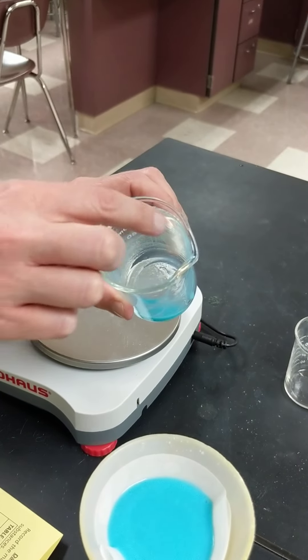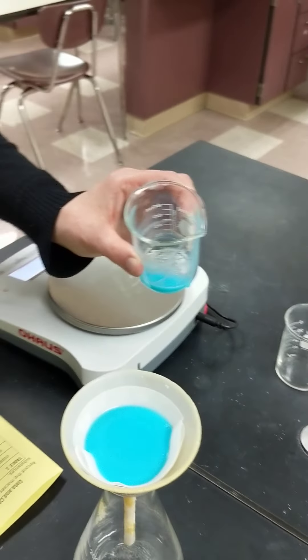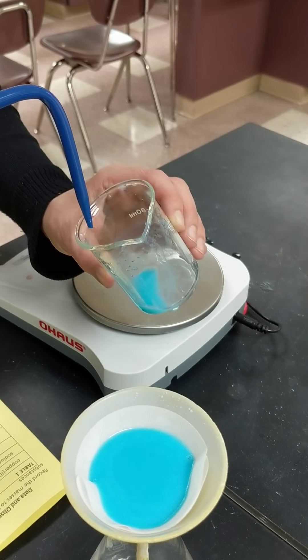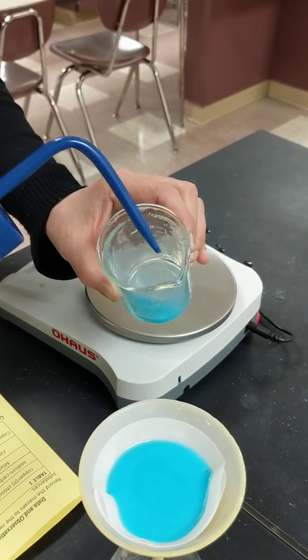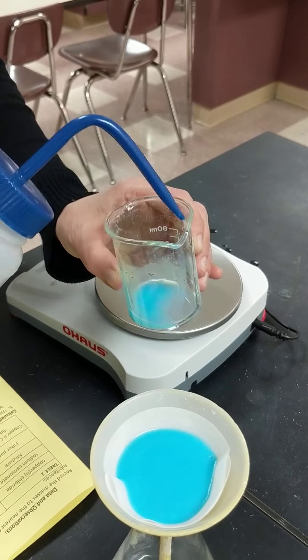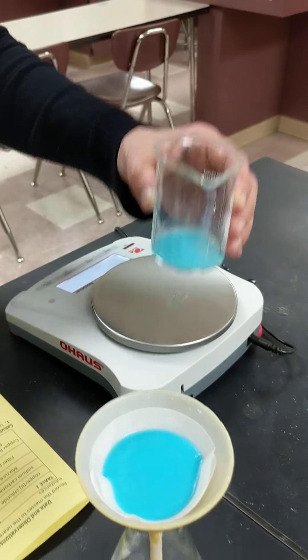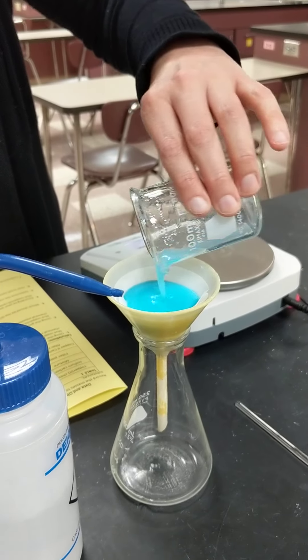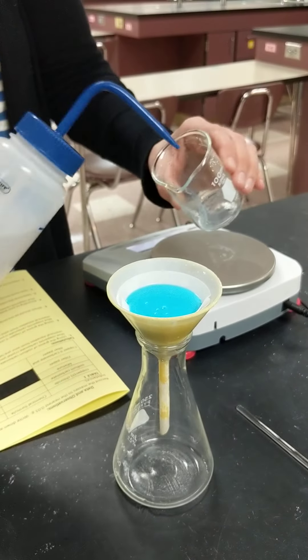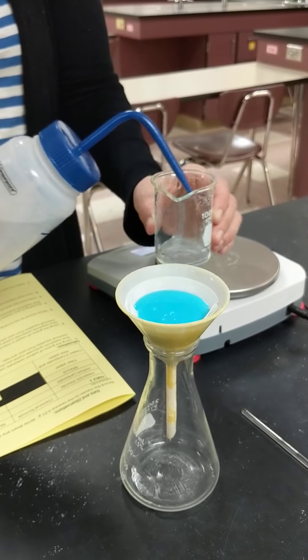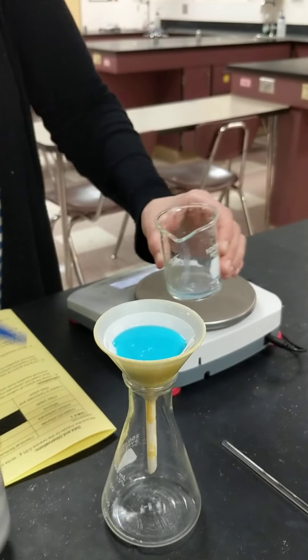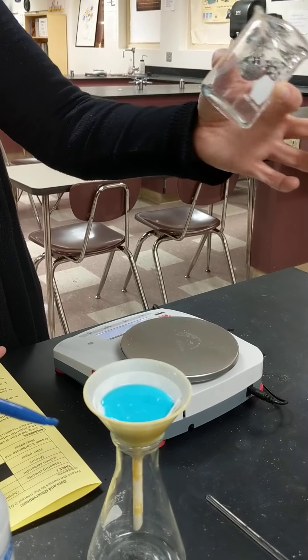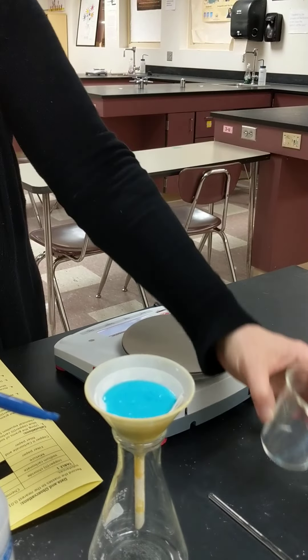And so what you do to fix that is they're going to be adding more water, because we want to get every single little bit. And so they're going to be adding more water and then adding it, and then they're going to keep doing that until they have a clean beaker. And so again, it doesn't matter how much distilled water we're adding, but you want this beaker to be pretty clean.